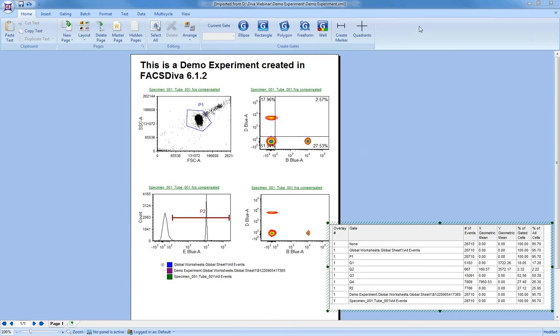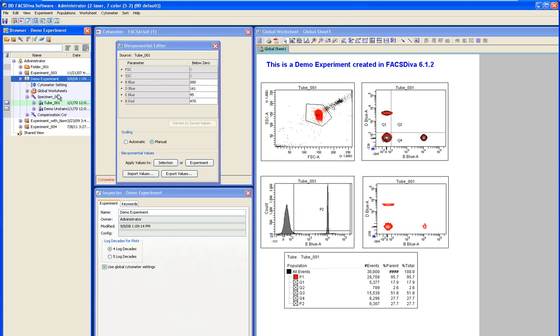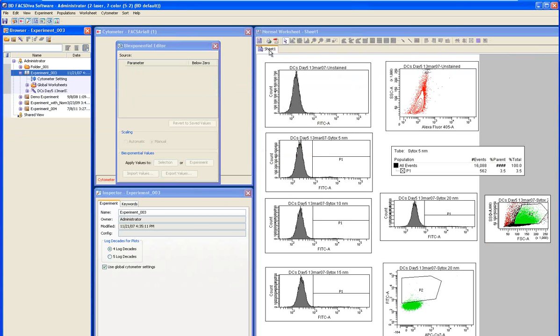So this is the first type of experiment. This is the acquisition template. I'm going to do another export and import and show you the analysis template. So we're going to go back into Diva and open up this experiment 3. And this worksheet is an analysis worksheet, and so when we later import it into FCS Express, it'll already load the data for us.